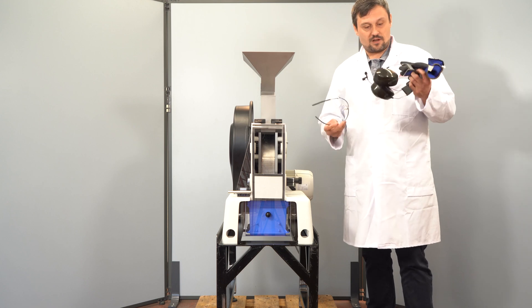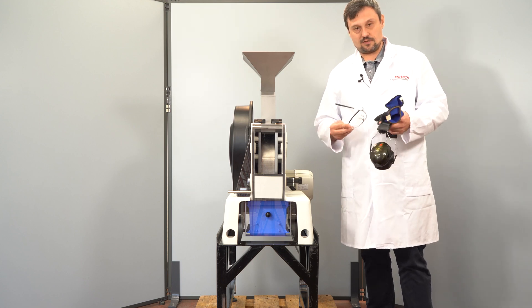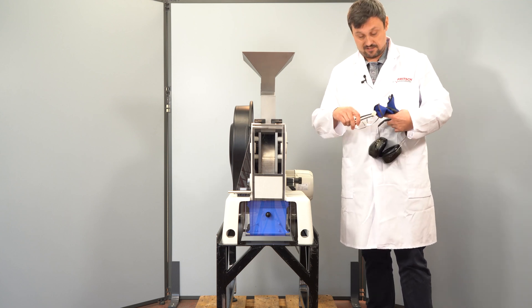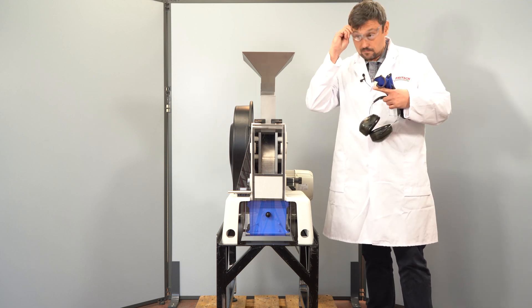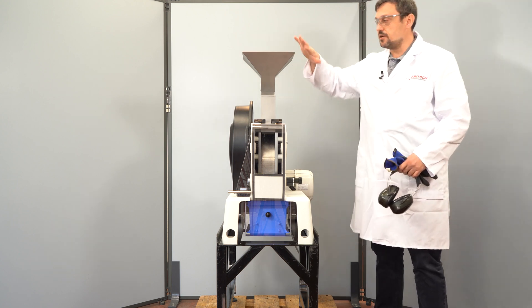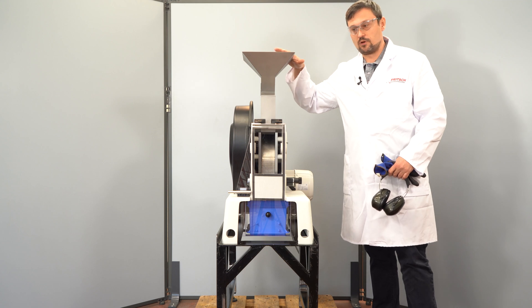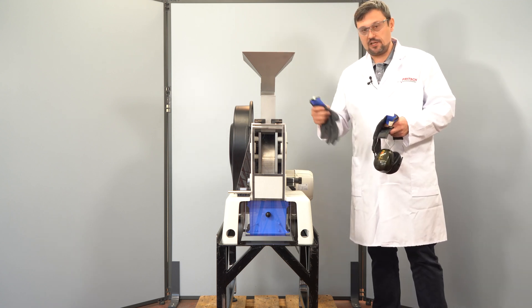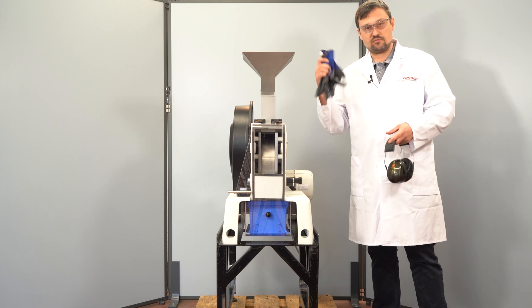You will need some safety equipment for grinding. We recommend safety glasses, because sometimes some fine dust may come out. For any operation on the mill — cleaning or otherwise — gloves are also recommended.